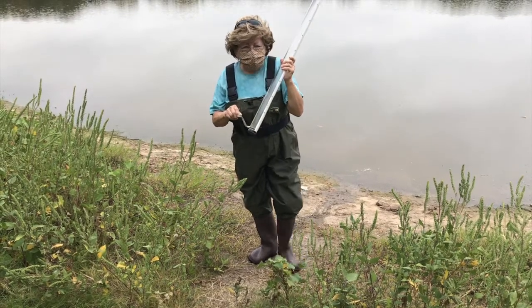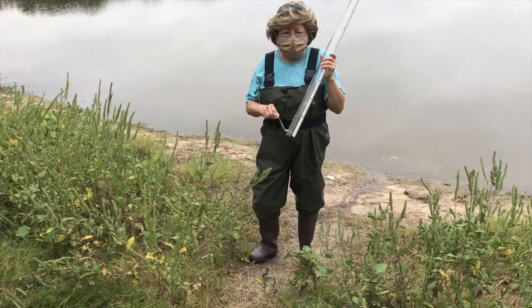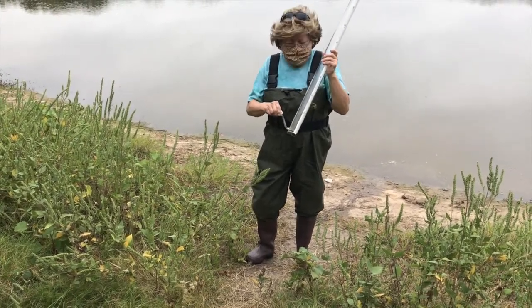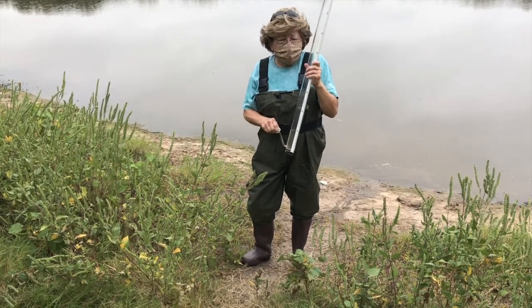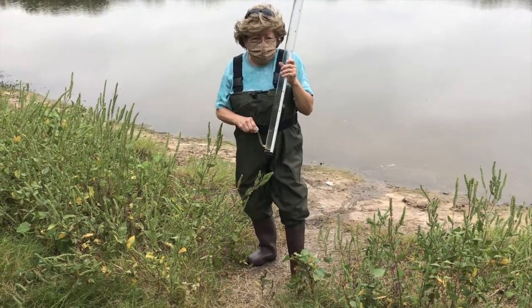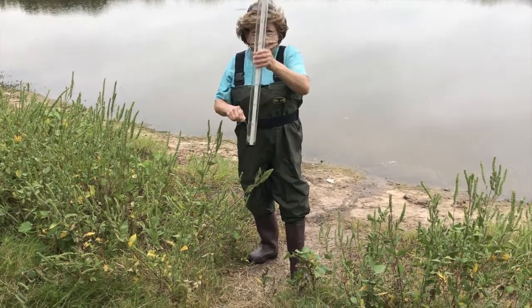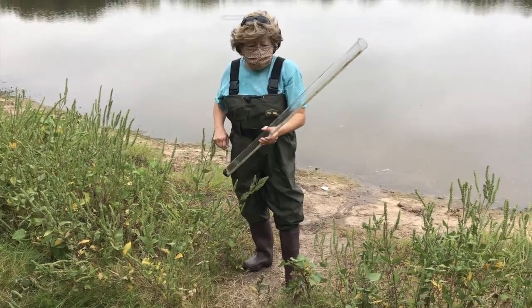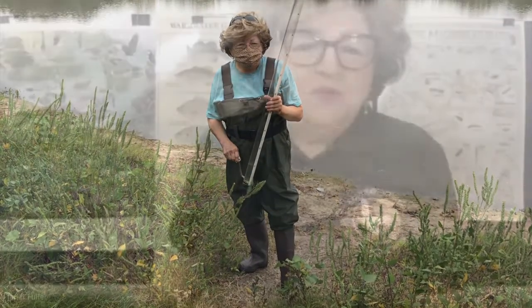And in order to clean it, to get this stuff out, we would have to put some flocculants in it and stir it and get that stuff out, and then it'd have to be treated for microbes so you wouldn't get Giardia and things like that. So this is turbidity, this is a turbidity tube, and the symbol at the bottom is the Secchi disc. Thanks so much. Have a lovely day.